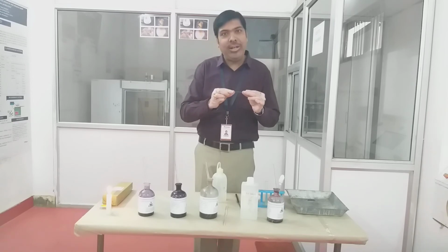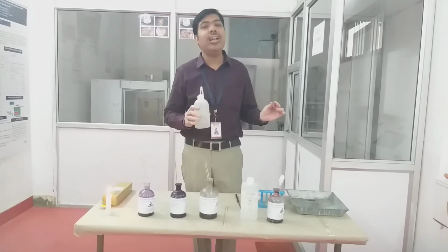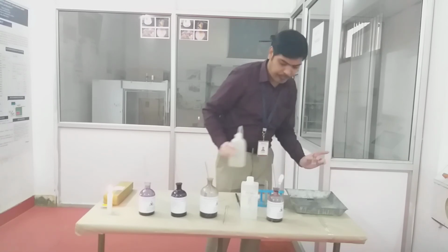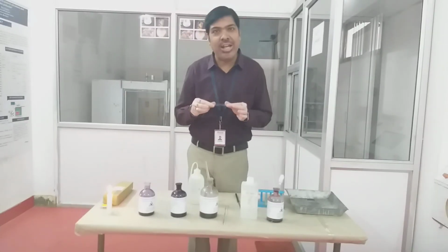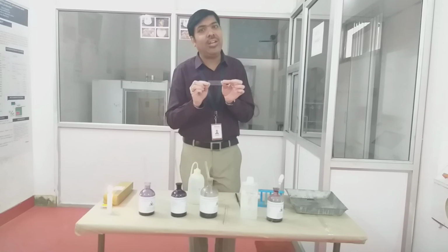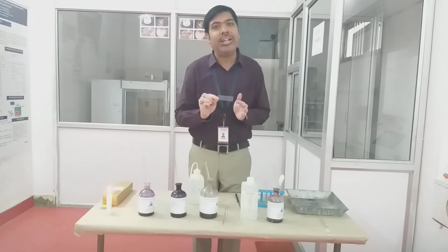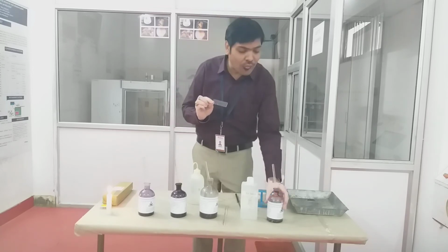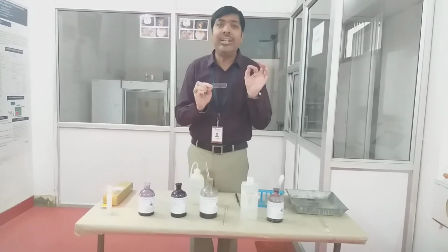Then after the application of the safranin, we wait for some time, and again wash the slide carefully with distilled water. Then we dry the slide and visualize it under the microscope. In this slide you will find two different categories of bacteria. One has a violet or blackish violet color; they are the gram positive bacteria. The second are the gram negative bacteria, and because of the safranin dye, they will be visible in a pinkish red color.